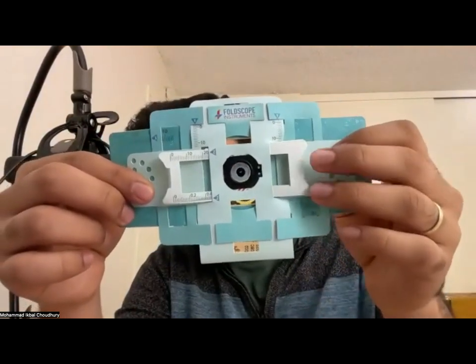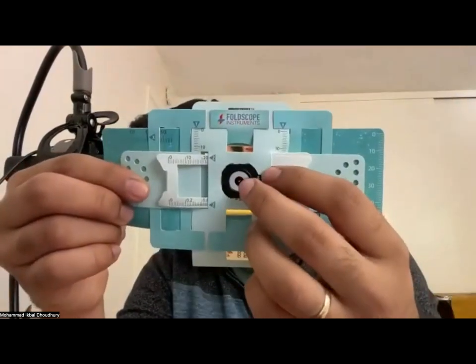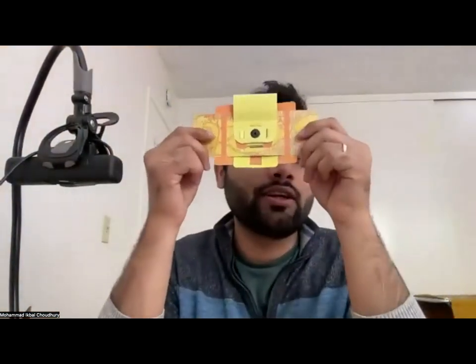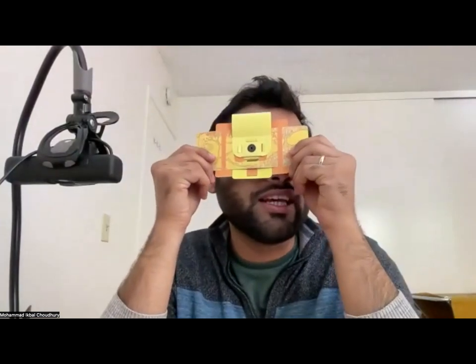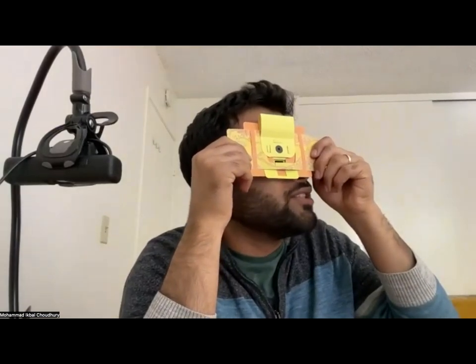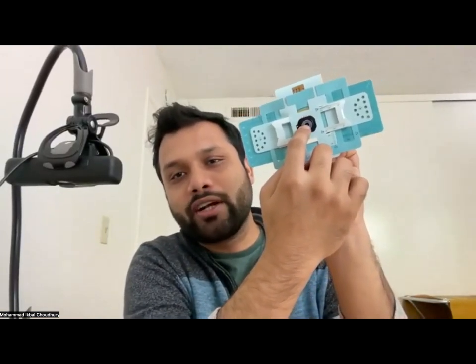So unlike modern microscopes, it has only one lens here, the black plastic thing that you see, and there's a tiny lens there. So you can flip it like that and point it, take it closer to your eyes and try to see through the lens by pointing it towards a light source. So once you do that, as you can see, I have my thumb here. I can do that movement and I can point it towards a light source. You will see a white background. I mean, there's no sample right now, I'm assuming. So it's just a white background, nothing much. But it's good to know that you can see through this lens with your eyes. Okay. So you have to keep it very close to your eyes to see it.